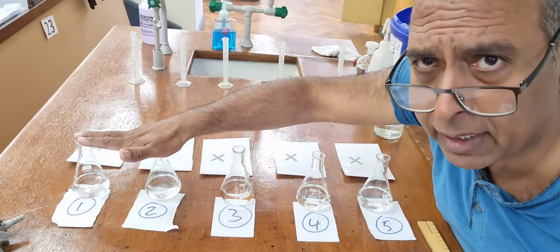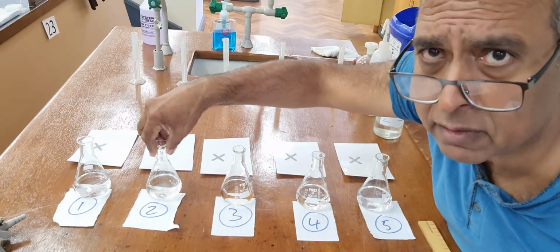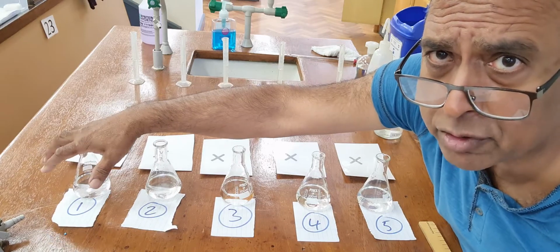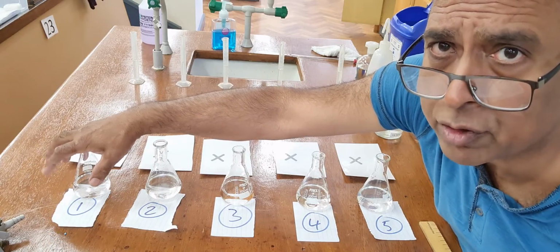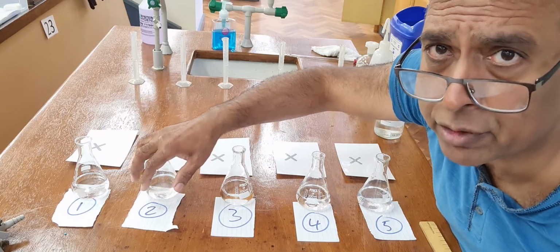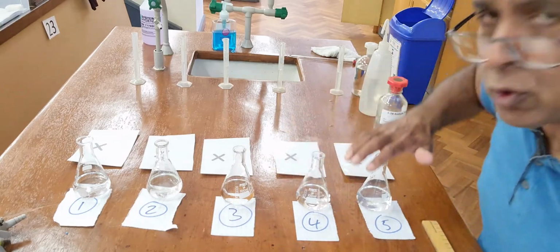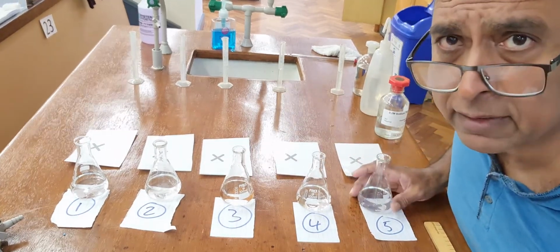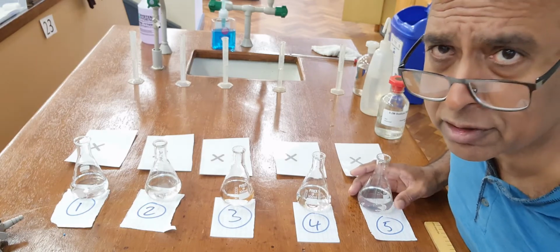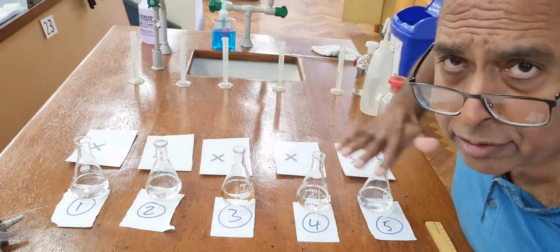Now let's get into the dilution. This is 4/5. This is 5/5. This is the same concentration we started with, 0.2 mole per litre. This is 4/5 of 0.2. This is 3/5. This is 2/5. This is 1/5 of that 0.2 mole per litre that we started with. I'll put those into the table later. But what I'm trying to say is there are 5 different concentrations.